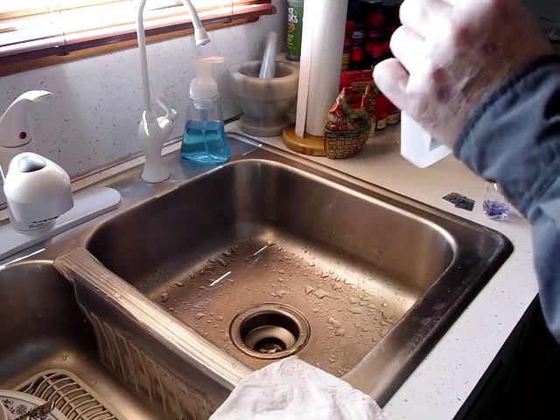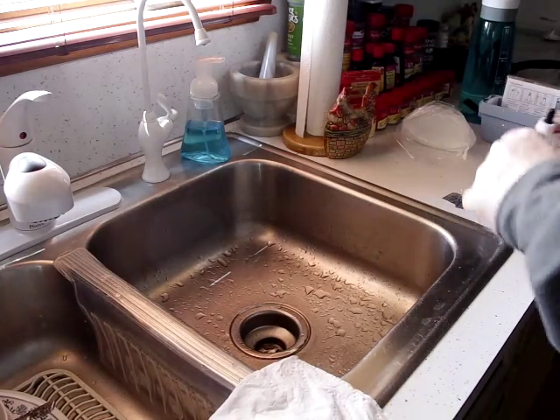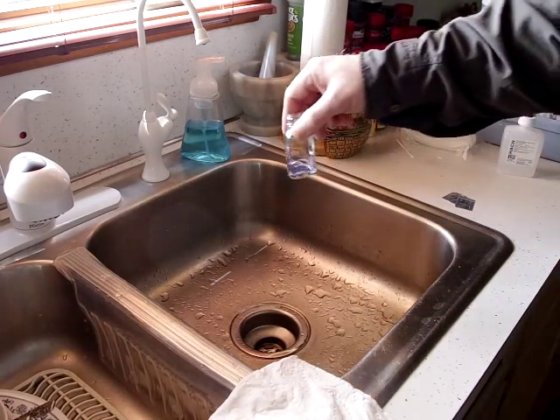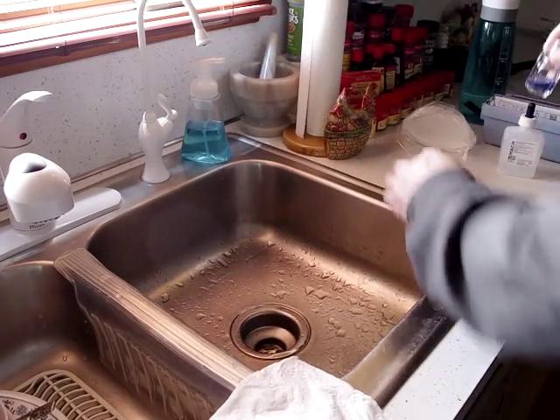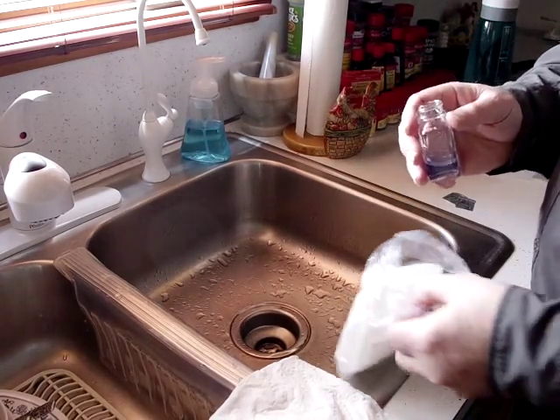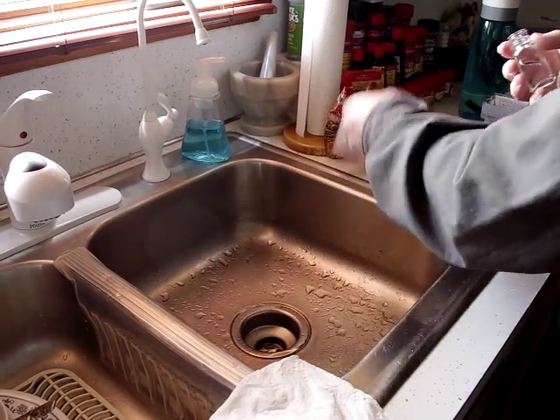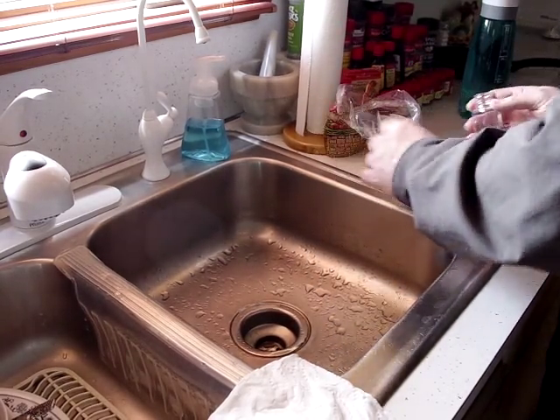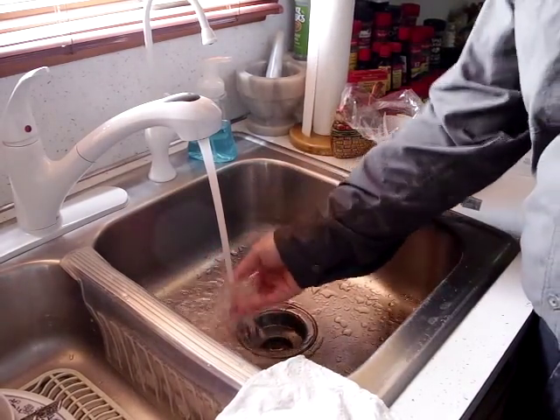That's fine by me. So now I know I've got 28 grains of hardness in my well water. One thing I do is make my own little containment system — a baggy with a paper towel in it. Now I'll do the tap water. Again, three times — rinse it. The most important thing is rinse it.